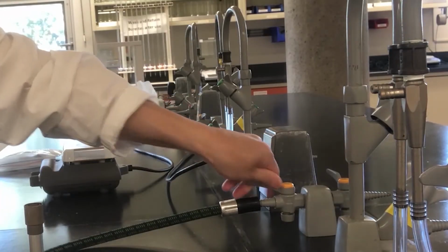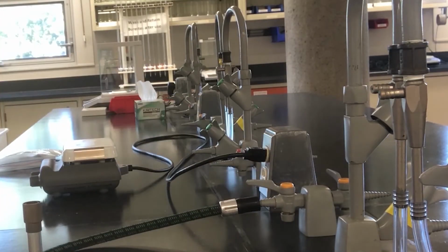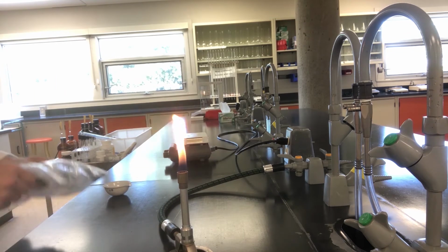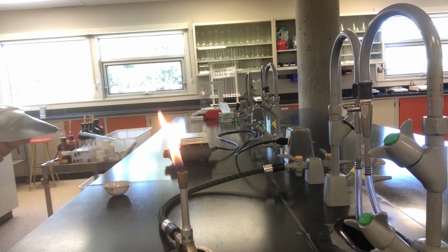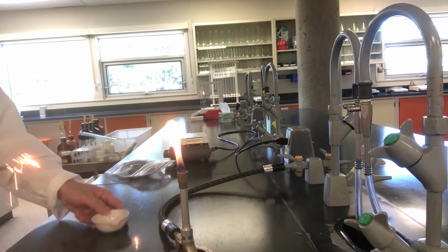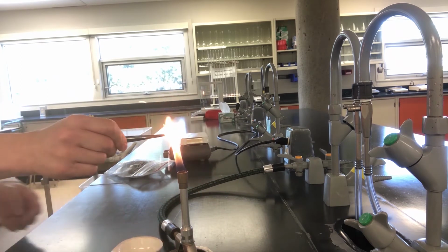First, turn on the natural gas line. Notice that it is parallel to the line of flow. By taking a small amount of steel wool with tweezers and lighting it on fire, watch what happens. What is the reaction? Write the balanced chemical equation.